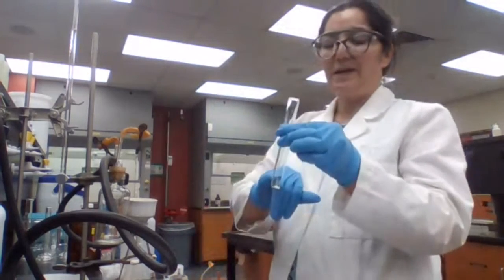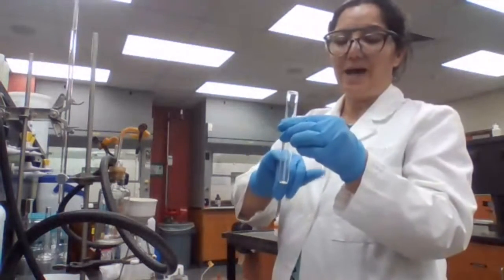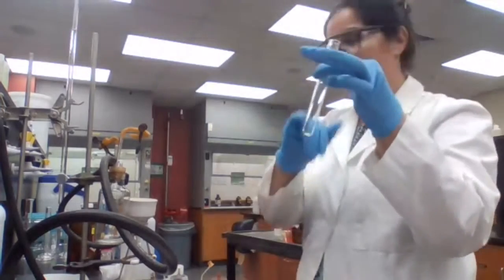I'm going to dissolve the sample in acetone and add the chromic acid, and bring it back to you.